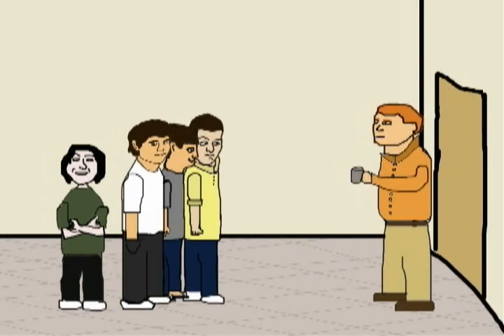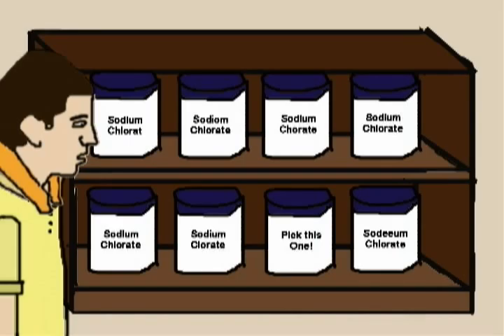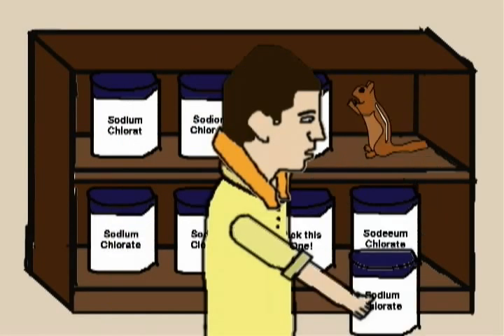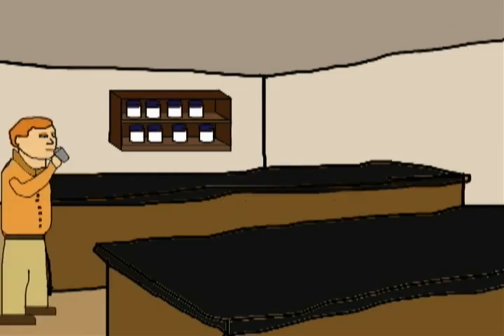I want you to go to the back and measure our ten grams of sodium chlorate. After that, I'll give you an A. Hey! Ahhhh! AHHHHH!!! Woohoohoohoohoohoohey!